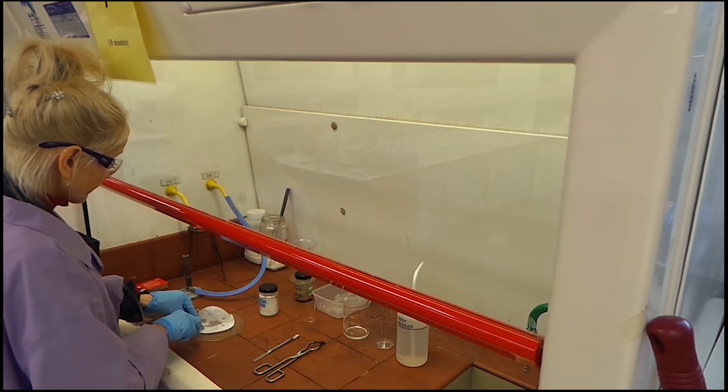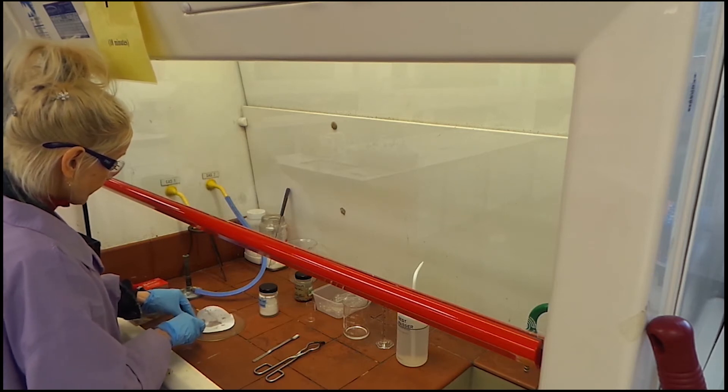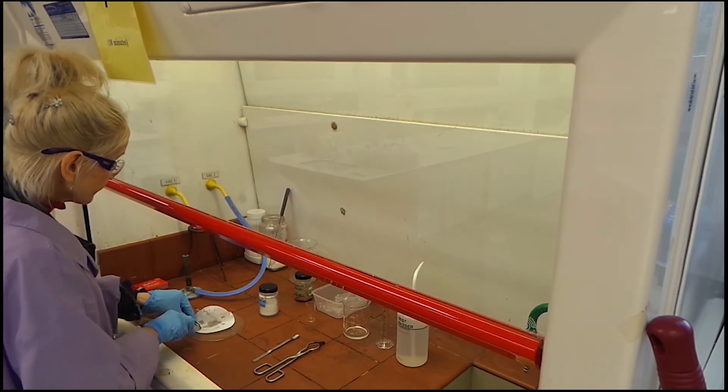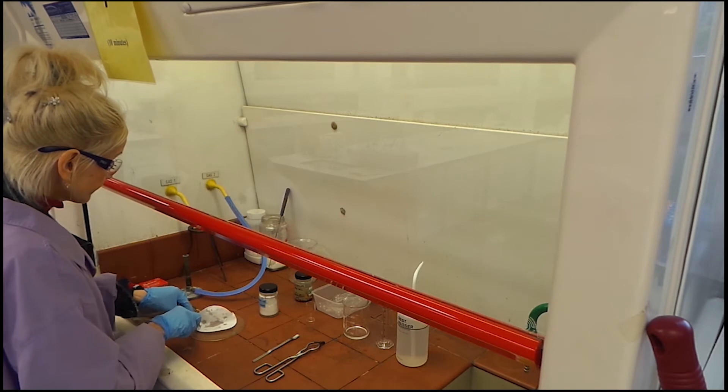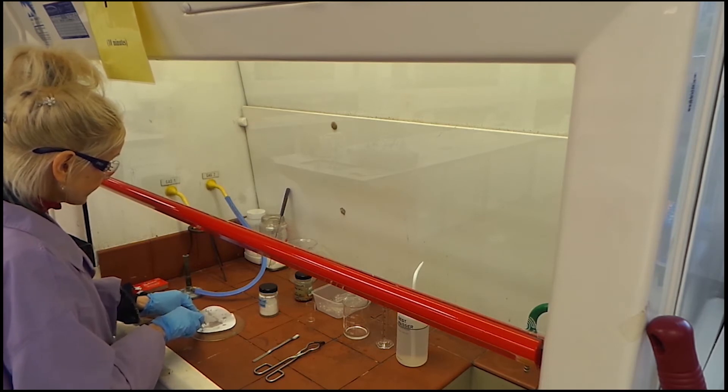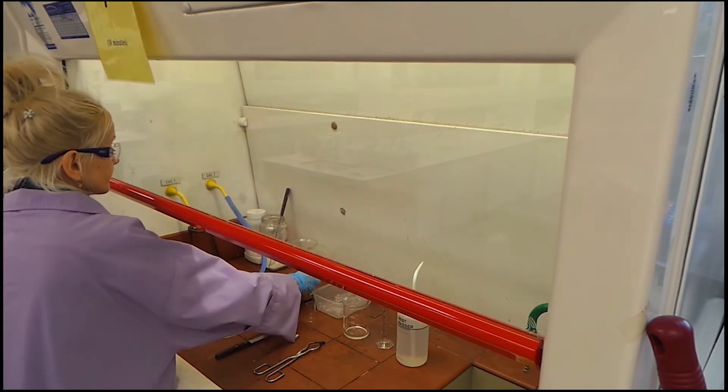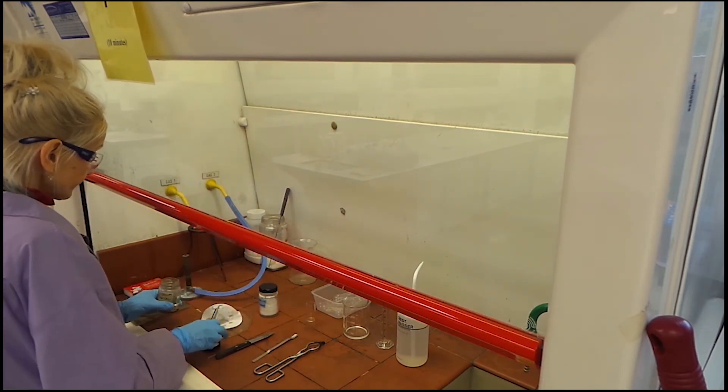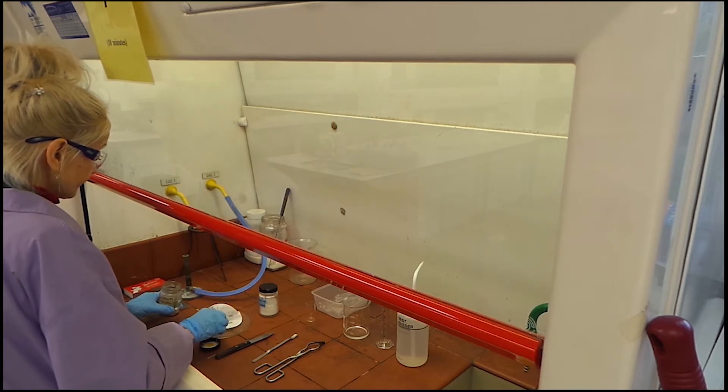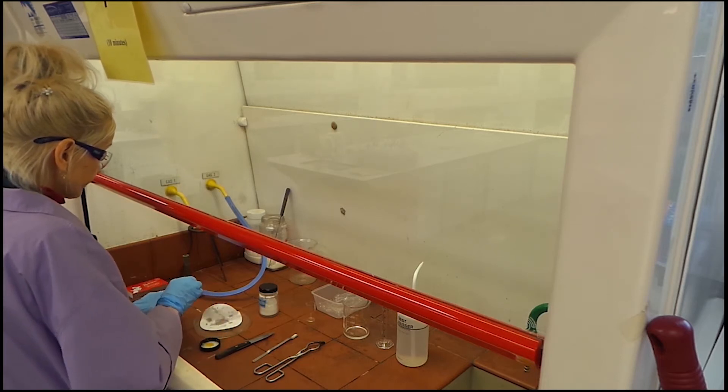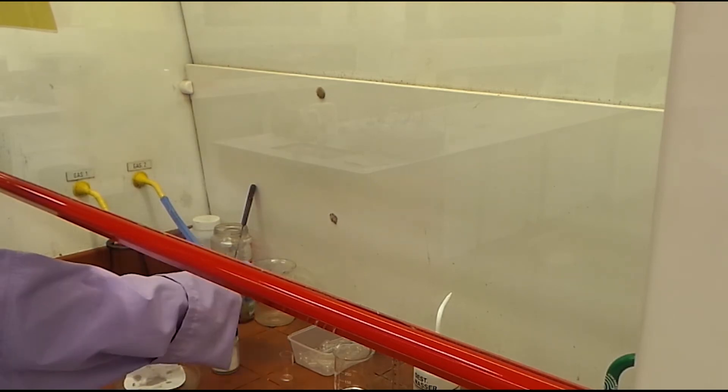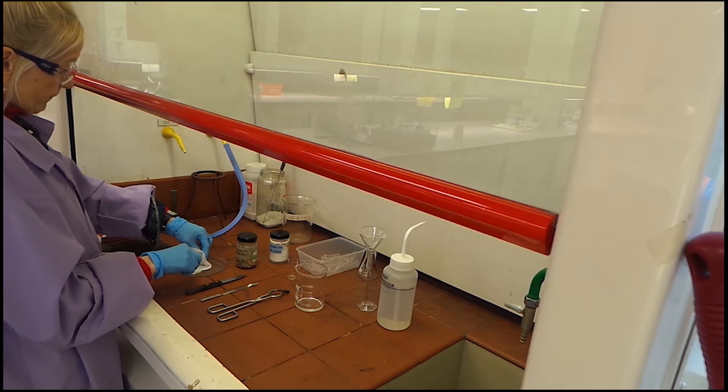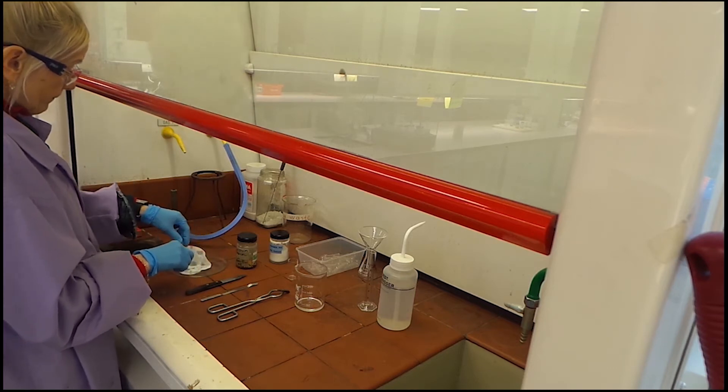Dry it with filter paper to remove the coating of paraffin when sodium is wanted for use. Then, freshly cut a small cube of sodium metal with the help of the knife. Return unused sodium to the storage container. Dry the sodium before placing it in a clean and dry ignition tube.